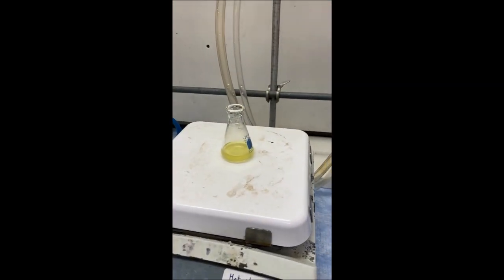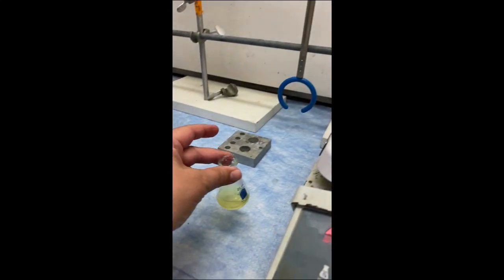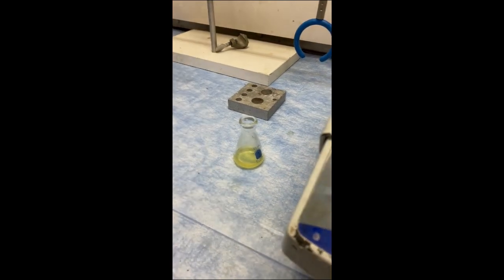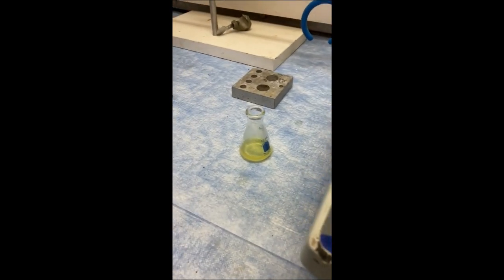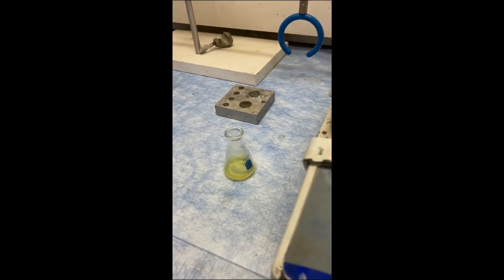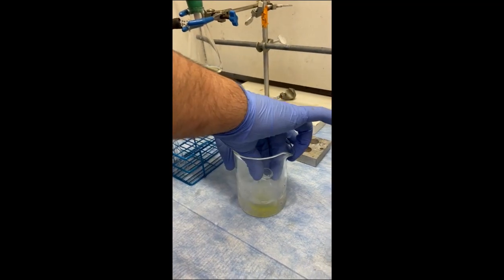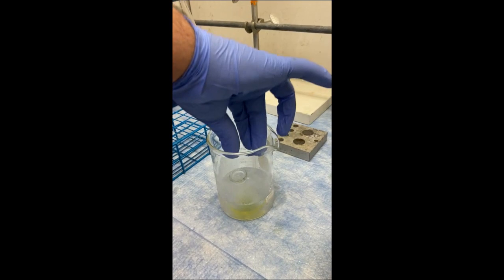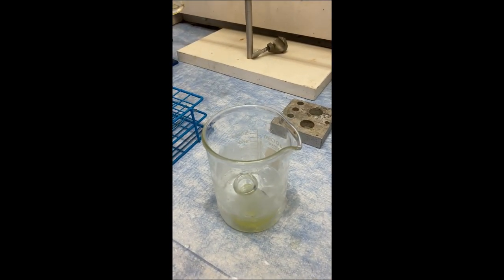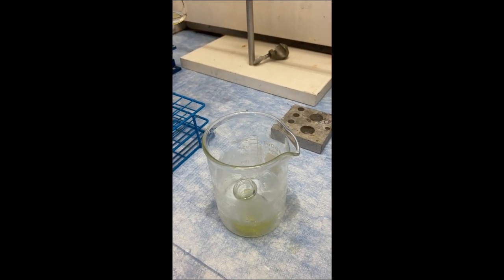Now that it's all completely dissolved, we're going to take it and set it at room temperature. Once it gets to room temperature, we're going to put it in the ice bath for about 15 minutes. So now that we've hit room temperature, we're going to put it in the ice bath for about 10 to 15 minutes. After that's over, we're going to filter, get a melting point, and an actual yield.